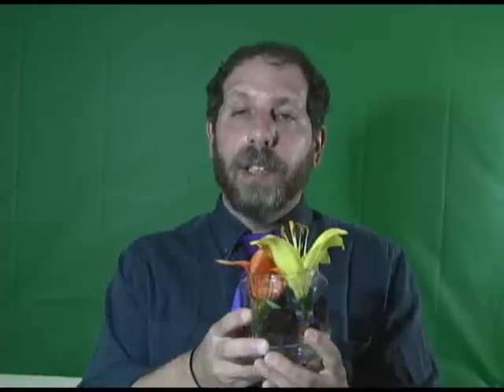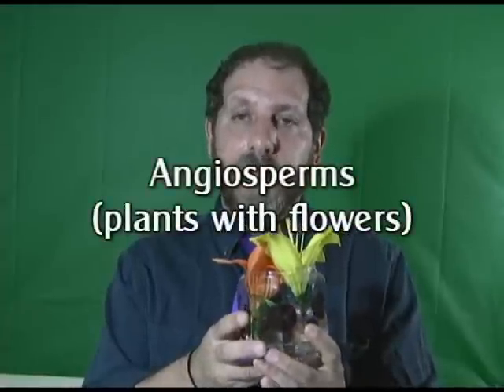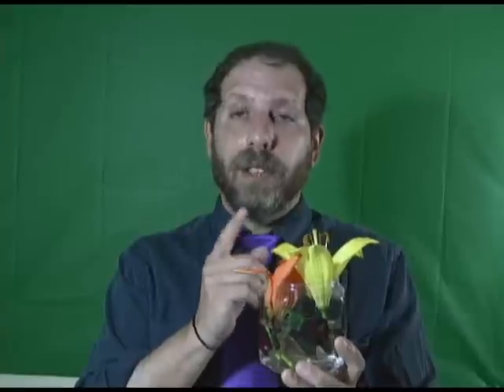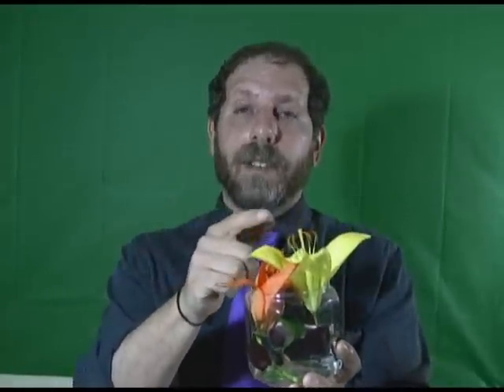We've got the flowering plants, and these are called angiosperms. An angiosperm is a plant that has flowers, and the flower is the sex organ. As you can see, and as you will see as I dissect it, the sex organs are these parts that are sticking up here and a little bit deep down inside. So we've got angiosperms or flowering plants — things like lilies, roses, tulips, dandelions, and even grass has flowers.